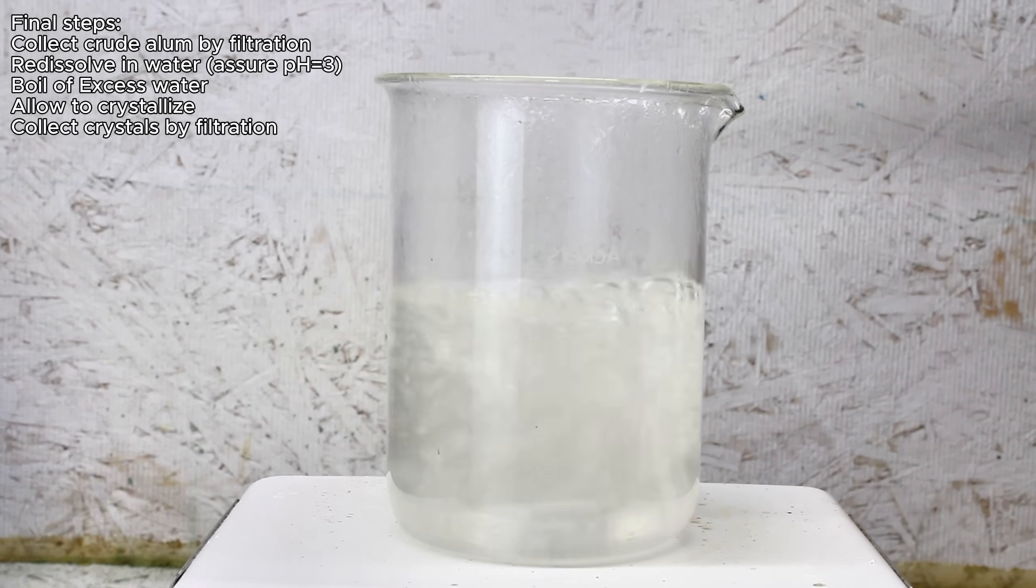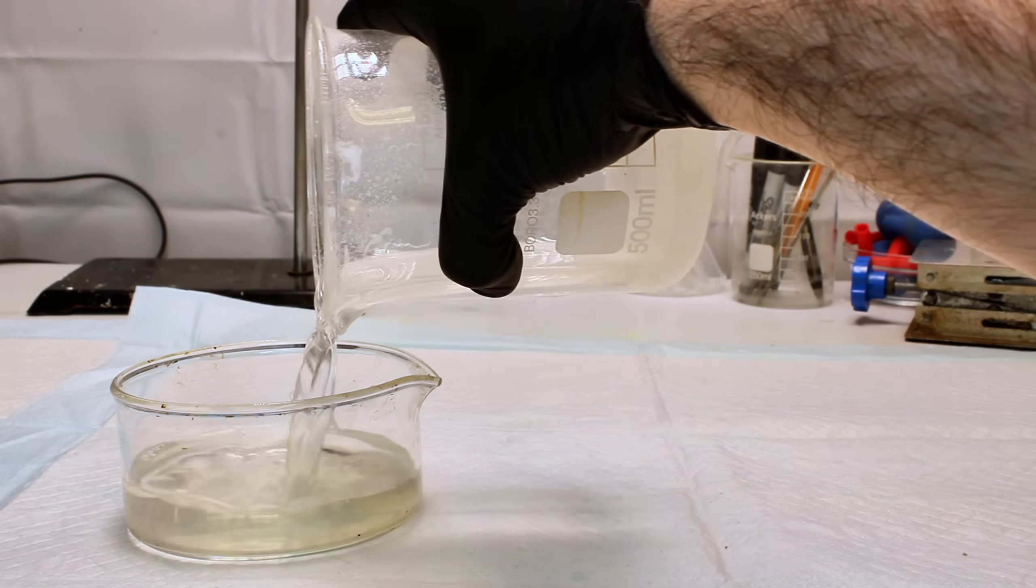And when I came back the next day, I had some absolutely beautiful crystal formation. Alum crystals aren't particularly colorful, but their shape and clarity is incredibly beautiful, so I'm thinking at some point I might try to grow the biggest one I can to see how it looks.